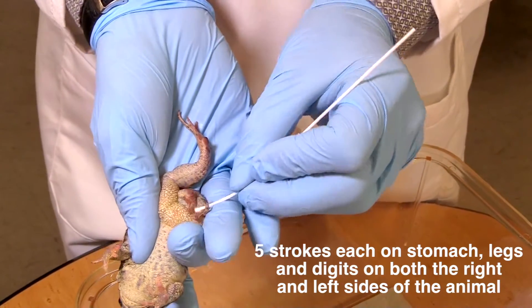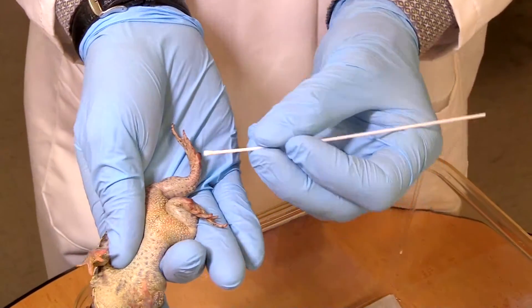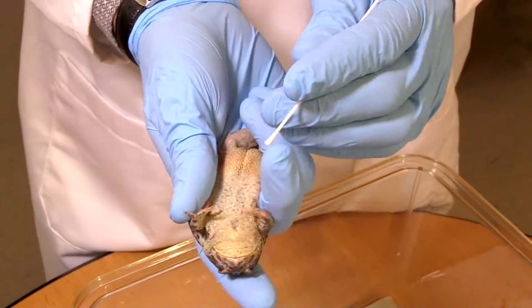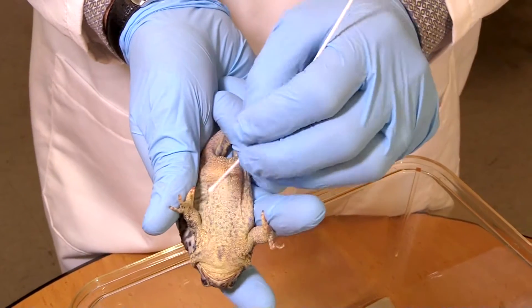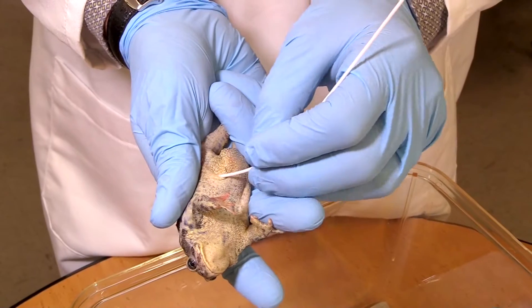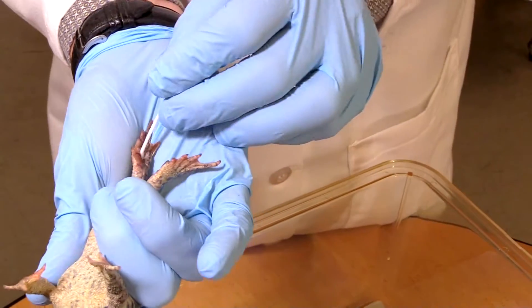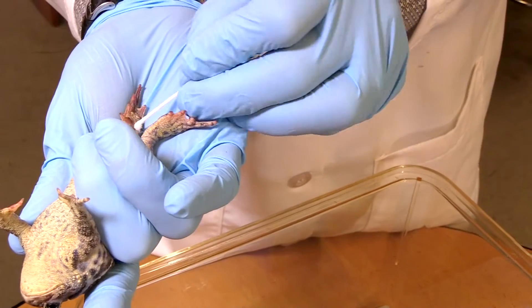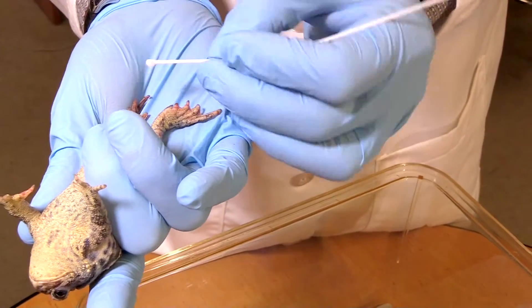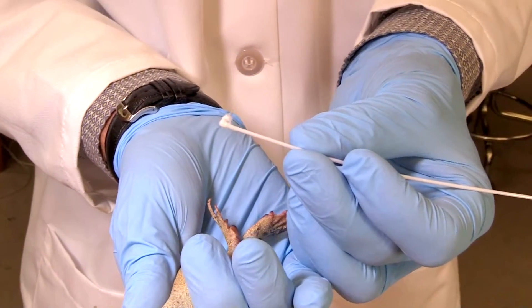And I'm going to do five here — one, two, three, four, five. So now I've done 15 on one side. Now I'm going to switch to the other side — one, two, three, four, five; one, two, three, four, five; one, two, three, four, five. Now notice the synthetic cotton is kind of coming off of there — that's good.